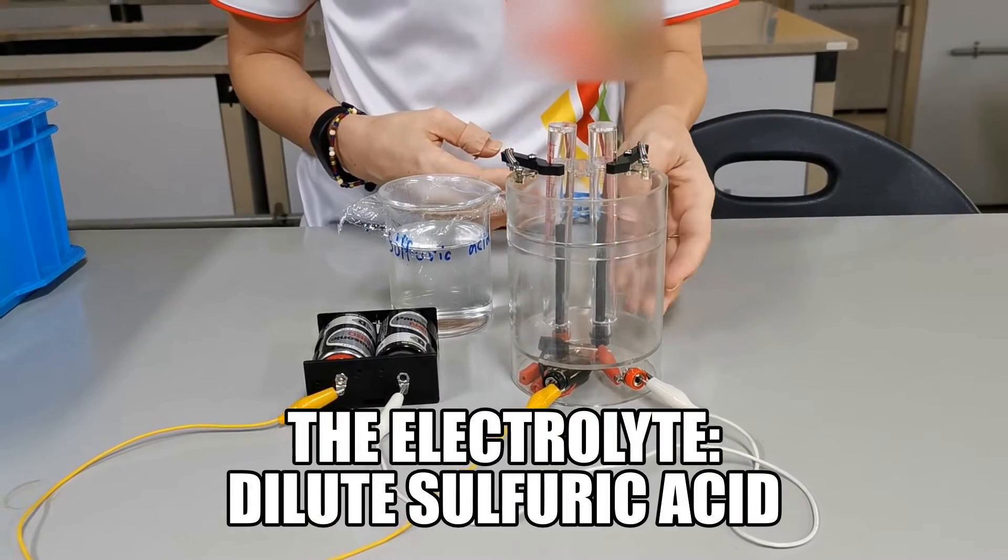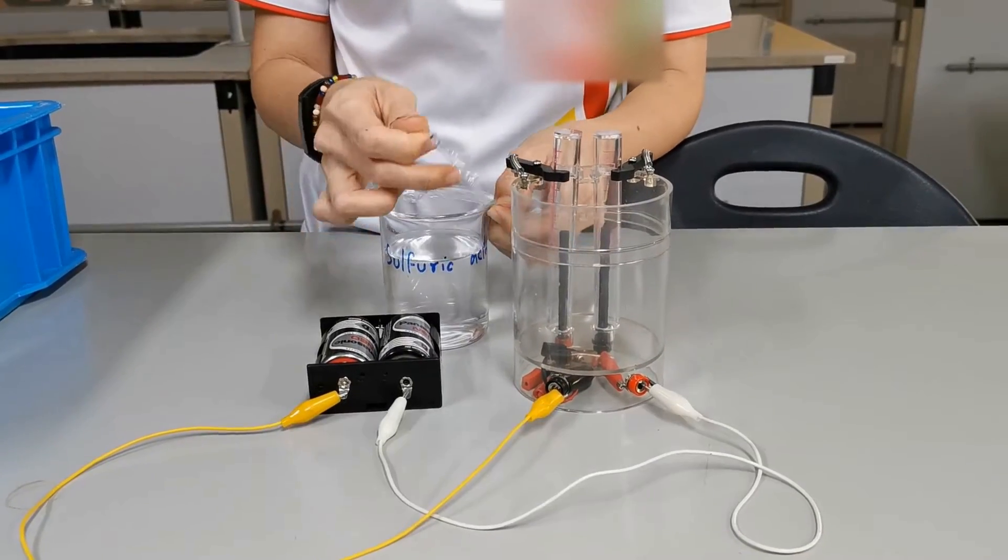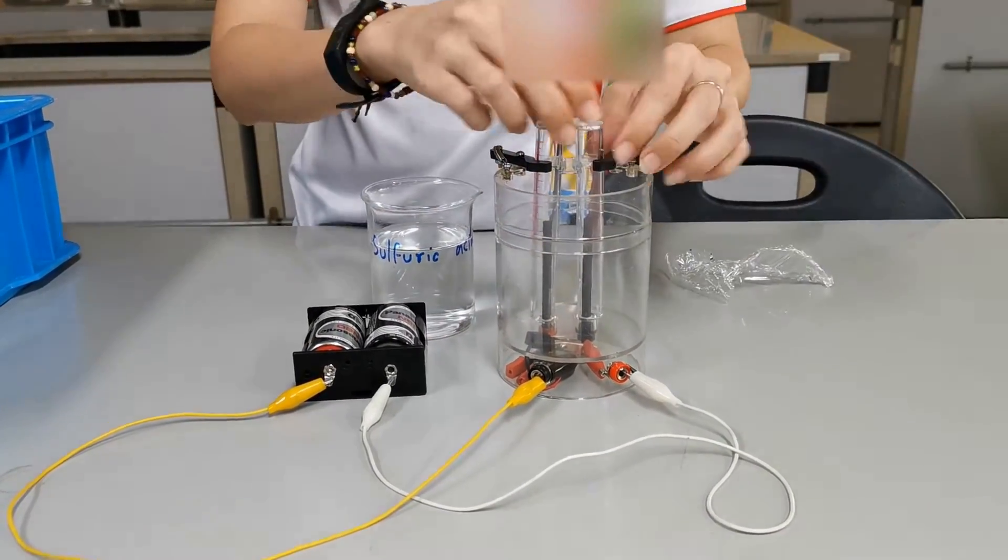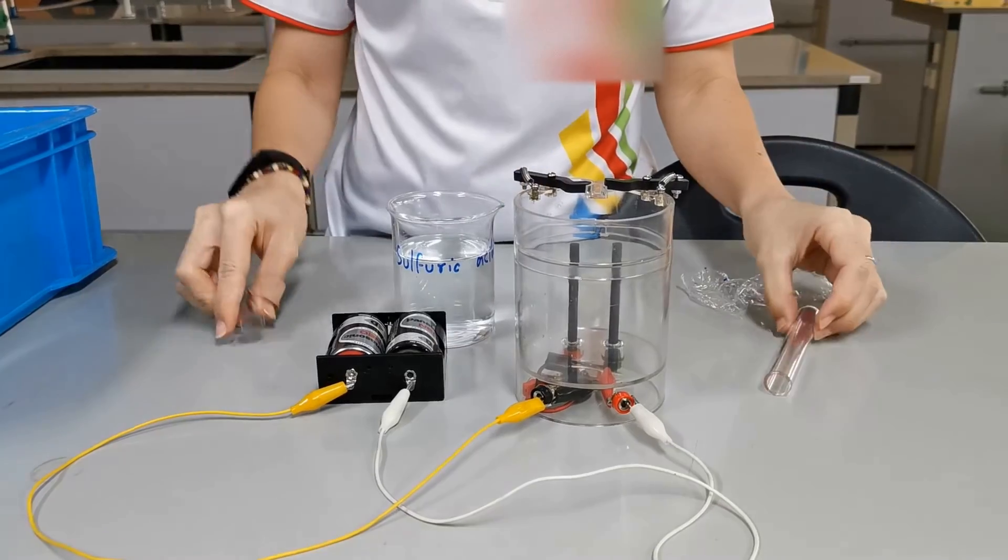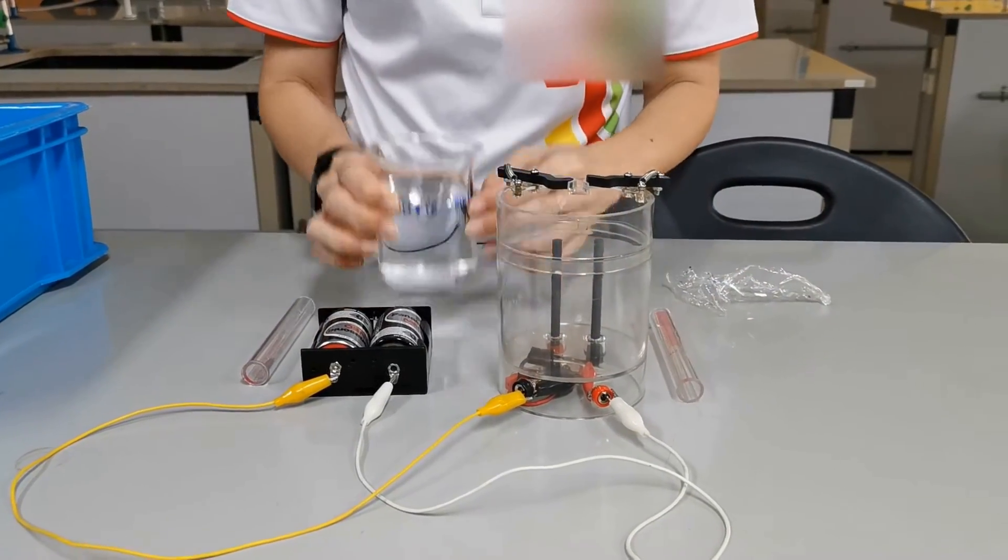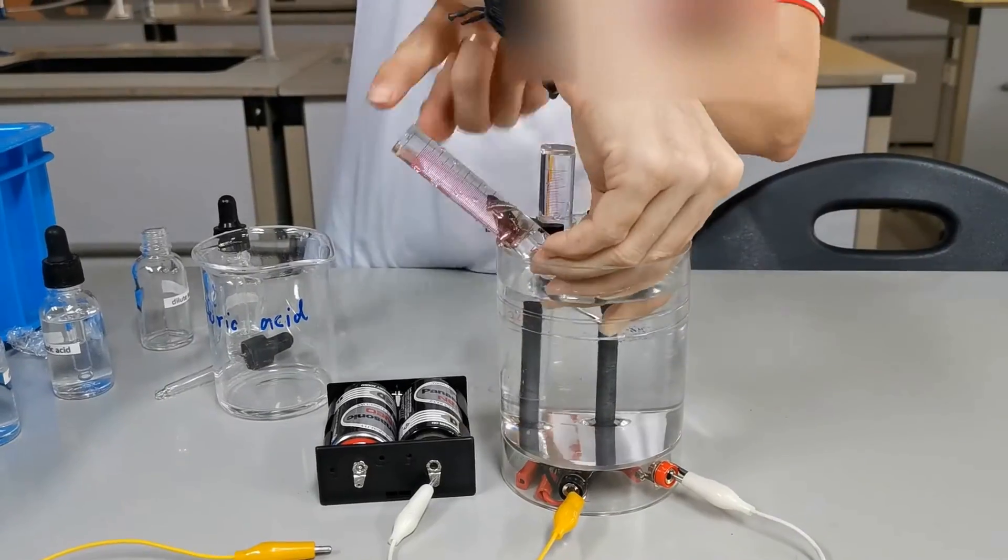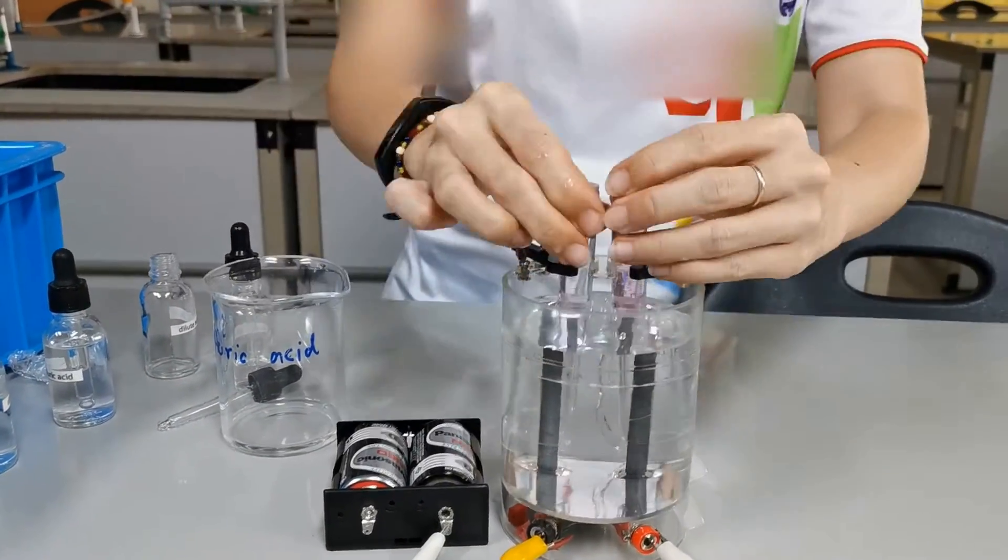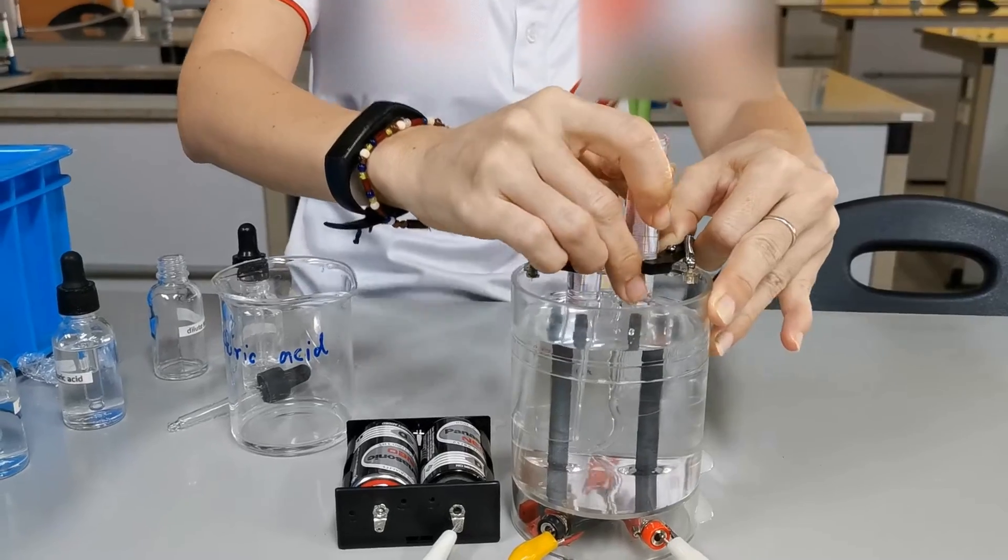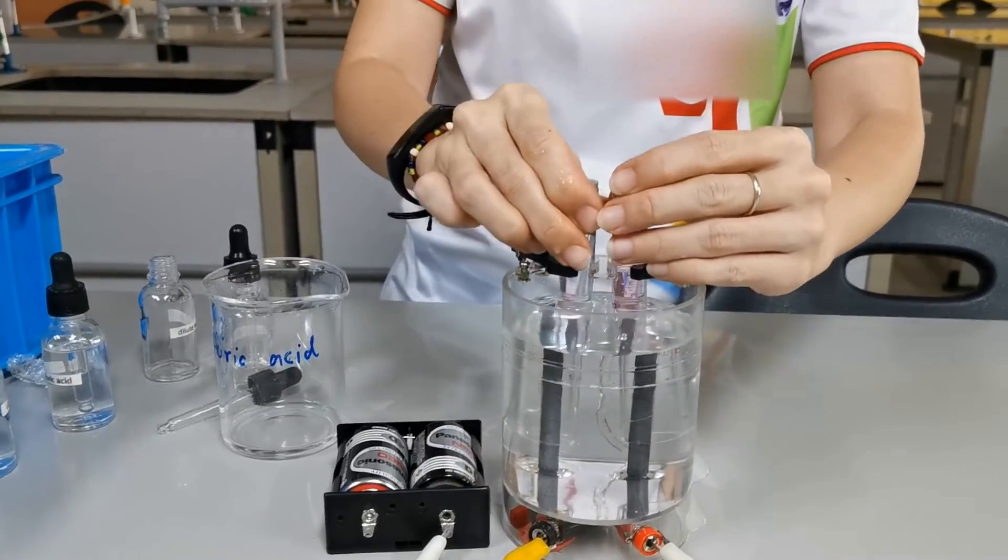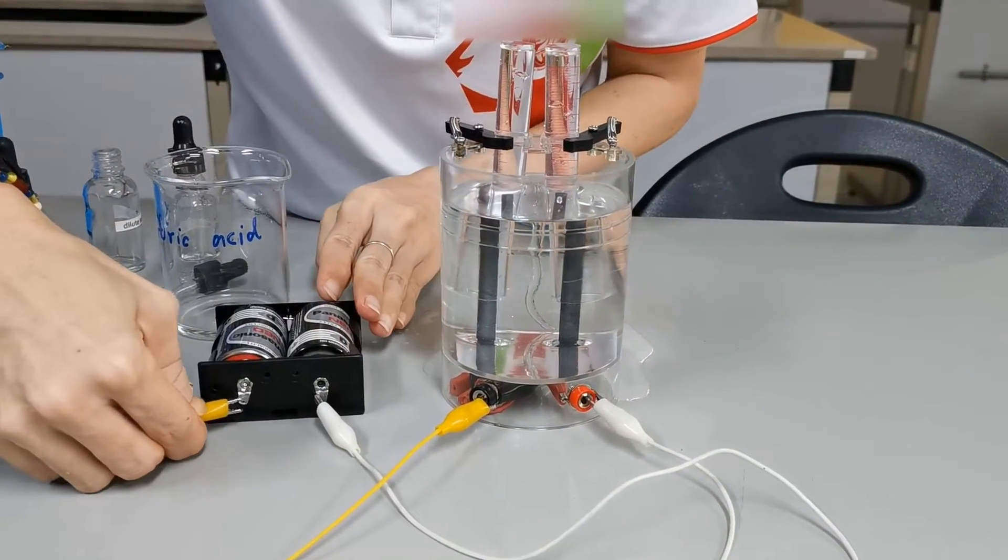The trick here is to fill the glassware and the tubes with sulfuric acid, so I'm going to do that now. Let's start the electrolysis.